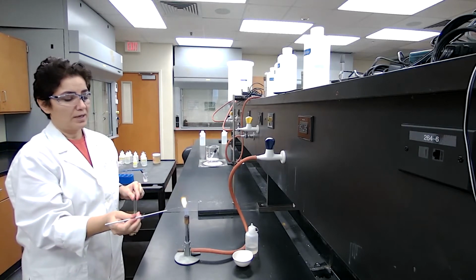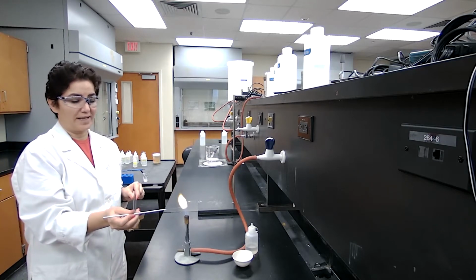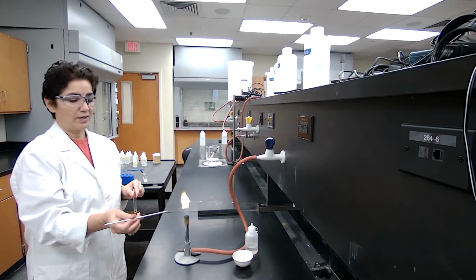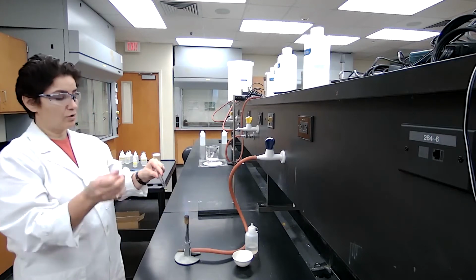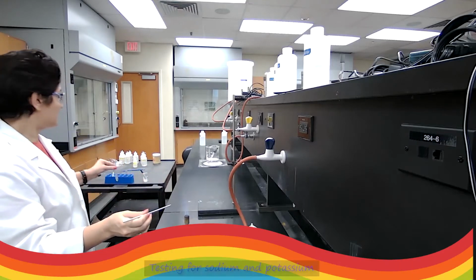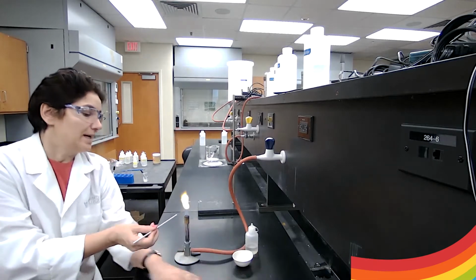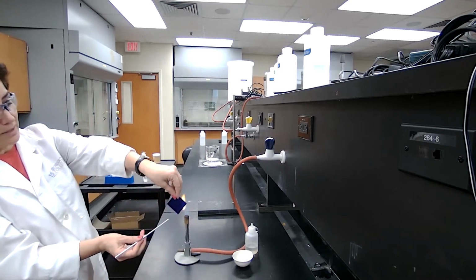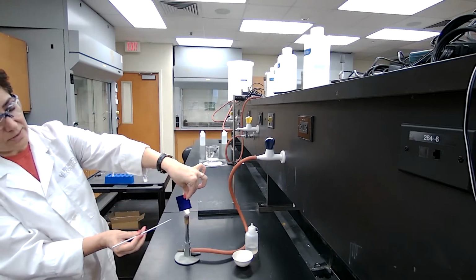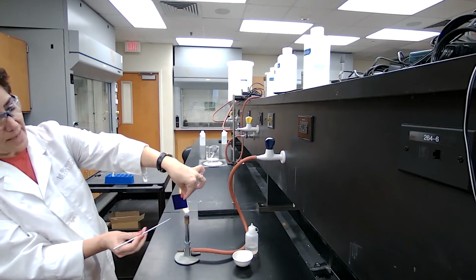Because it's unknown, I will not tell you that here is this ion or that ion. As I said before, record your observation. We are going to look at it straight without the cobalt glass, and we are also going to check the flame through the cobalt glass. With the cobalt glass also, we are going to see if you have any new color or not. Record your observation. You're going to have to do a close-up caption for this one.